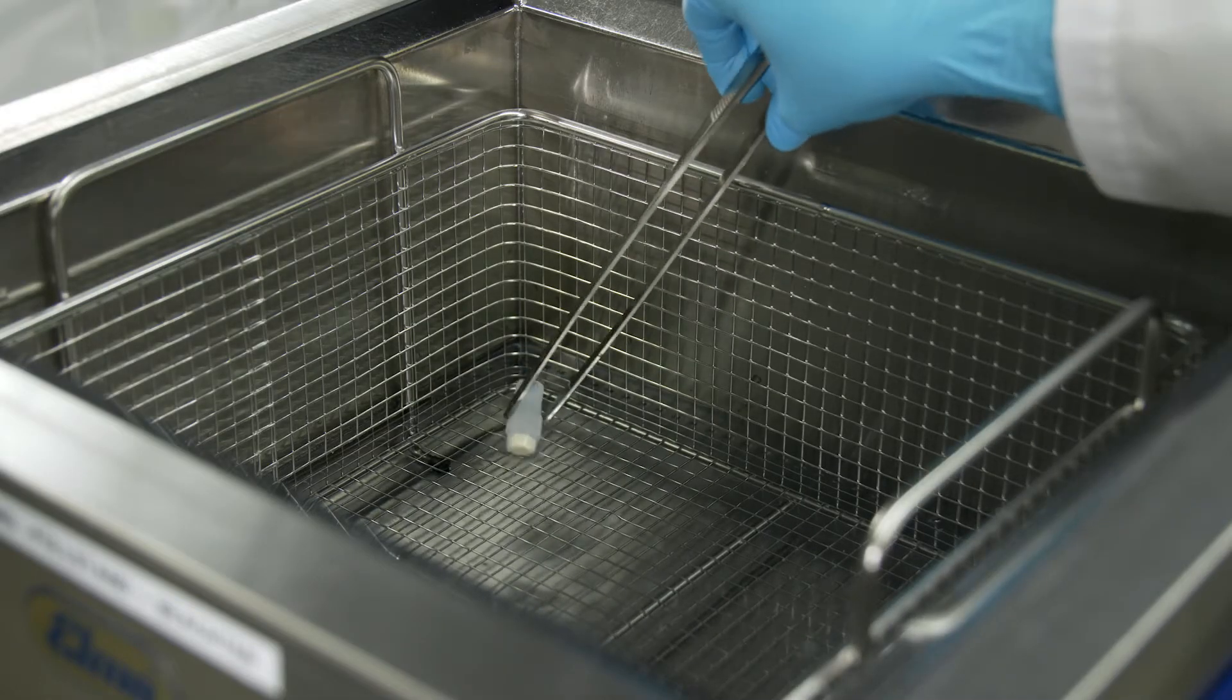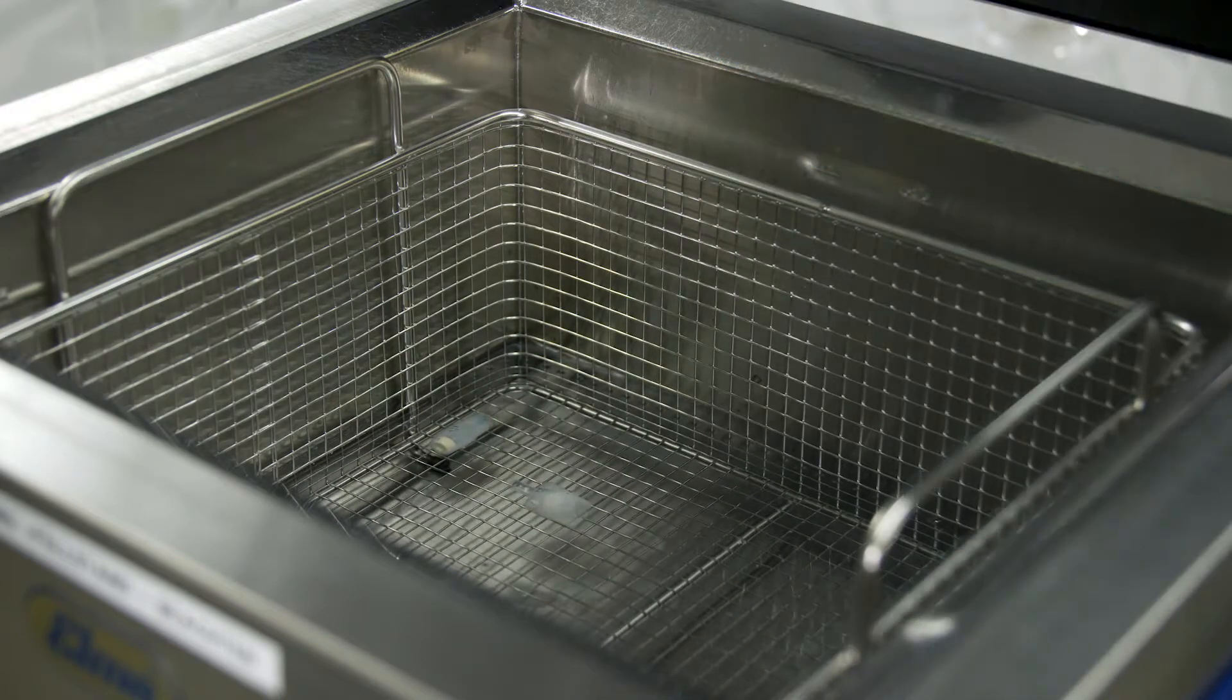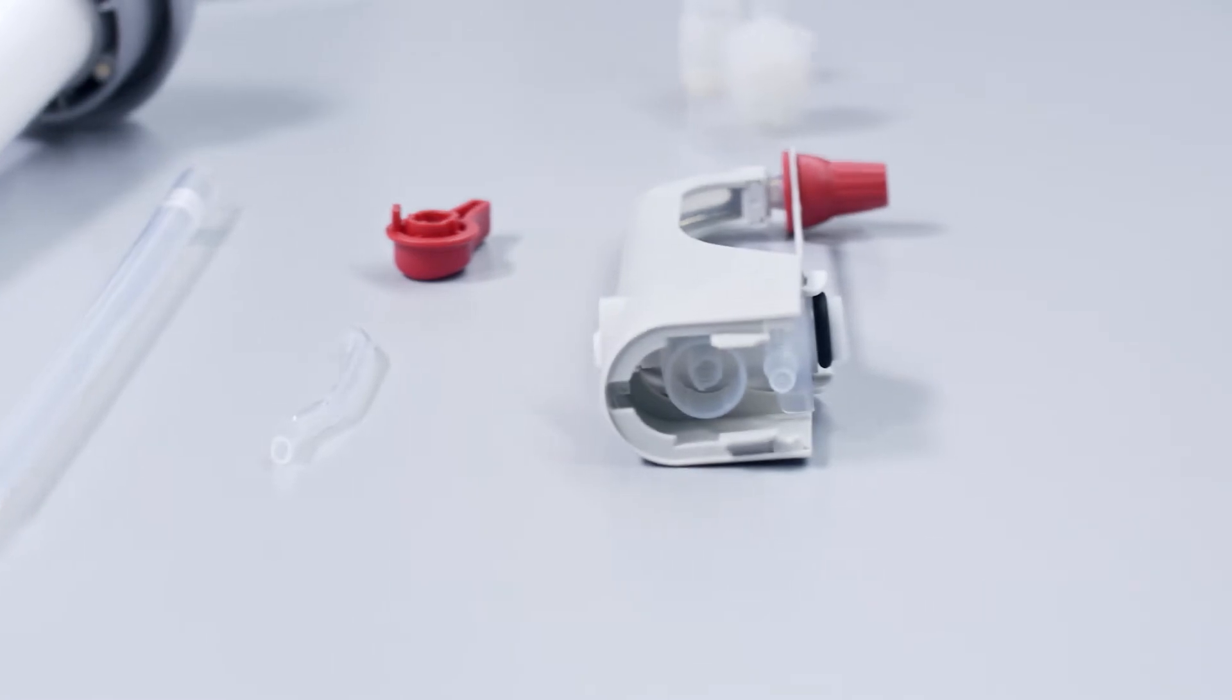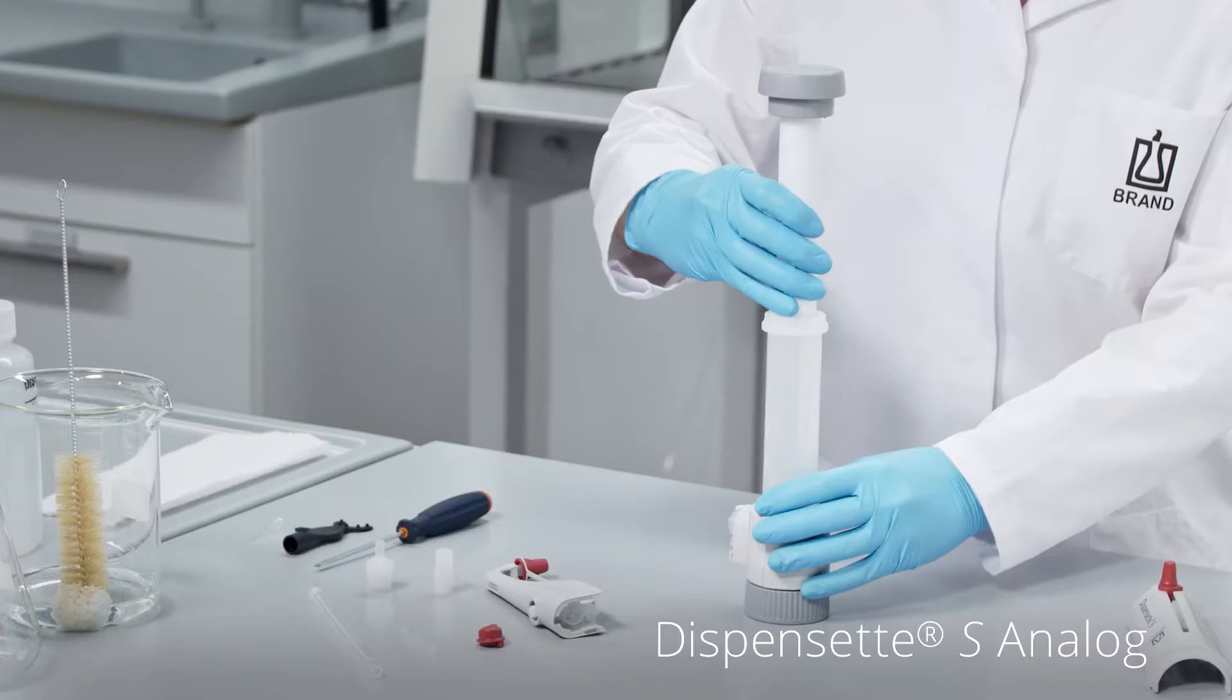Both individual components and the complete instrument can be cleaned in an ultrasonic bath. The housings, pistons and cylinders are individually matched and must not be interchanged with pistons from other instruments.